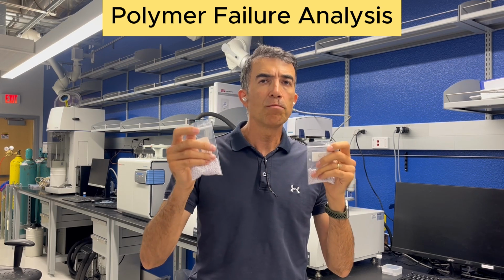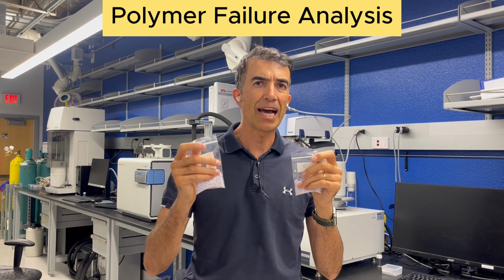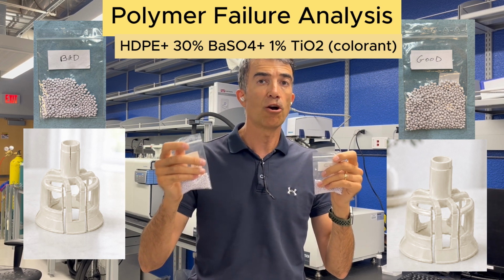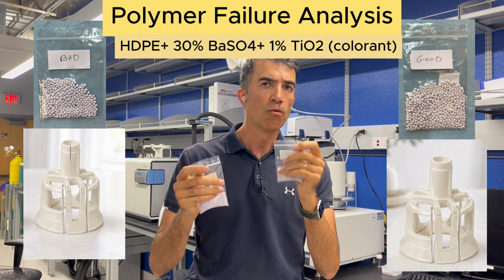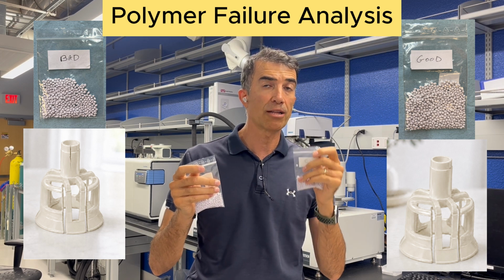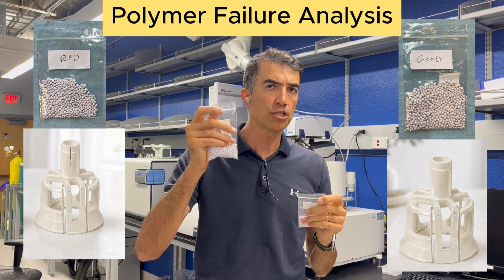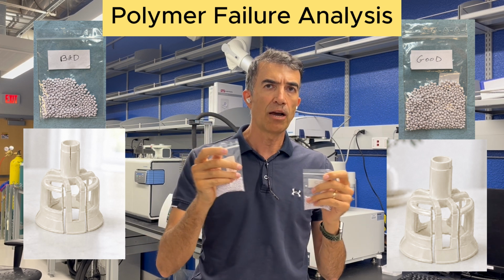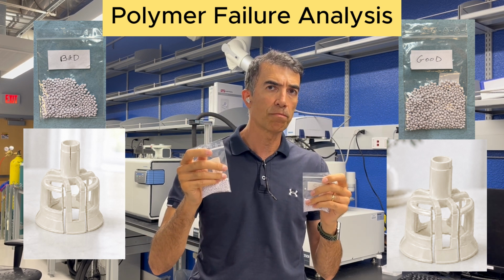We have received two polymer samples. They have the same formulations, but they give different results. They were produced on 2 different days. One of them produces parts that are good. The other produces parts that crack during assembly. They are used to make injection molding parts.